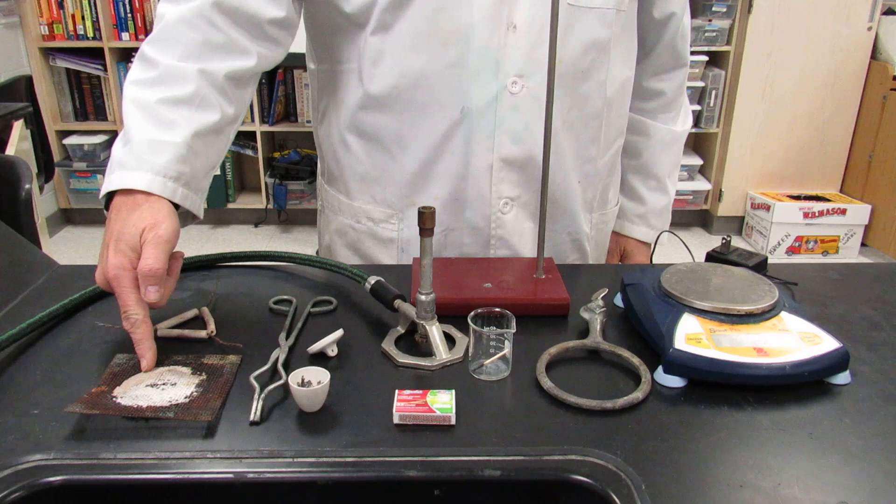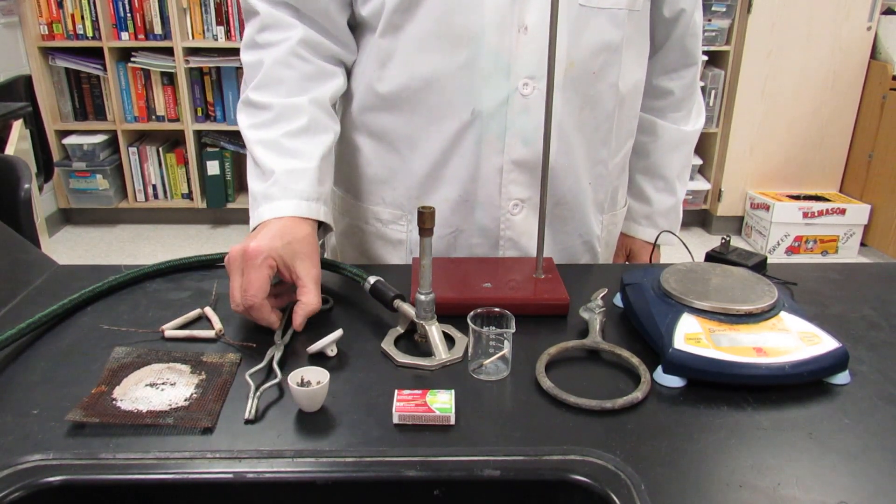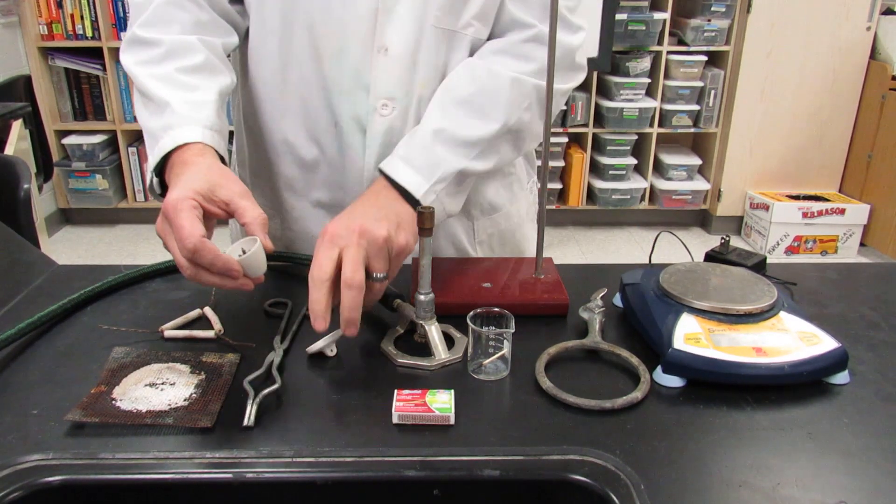For this lab you're going to need wire gauze, clay triangle, crucible tongs, a crucible and cover.